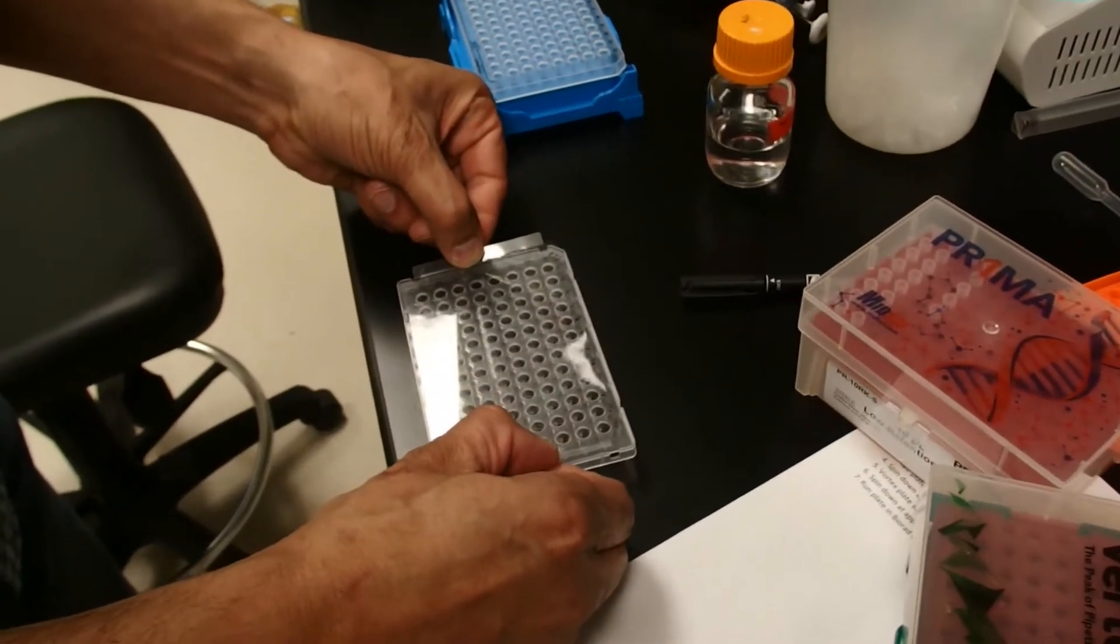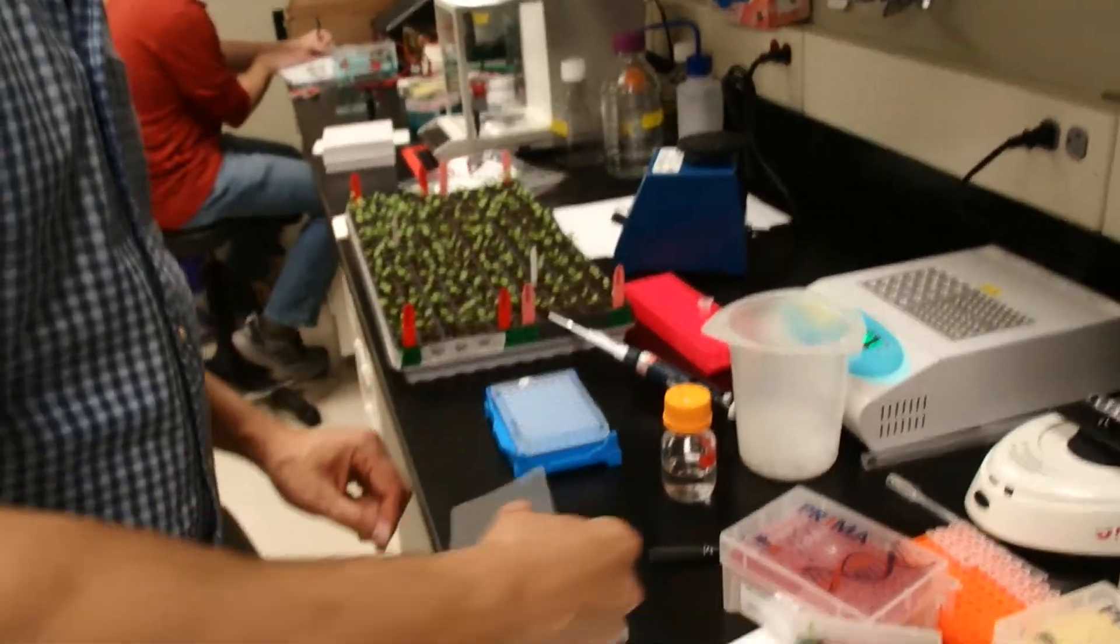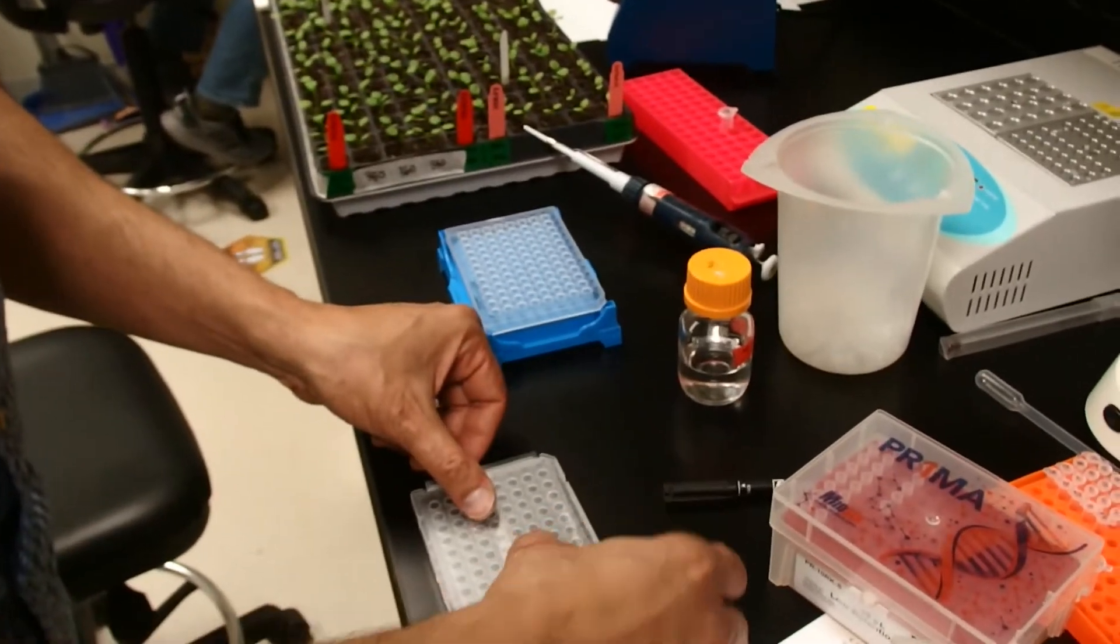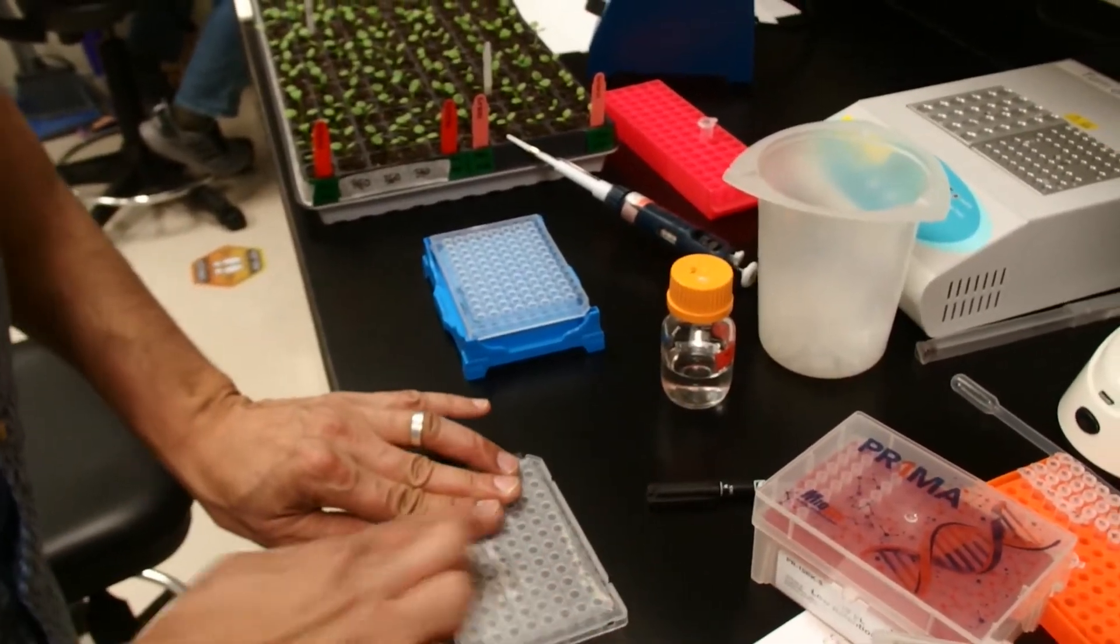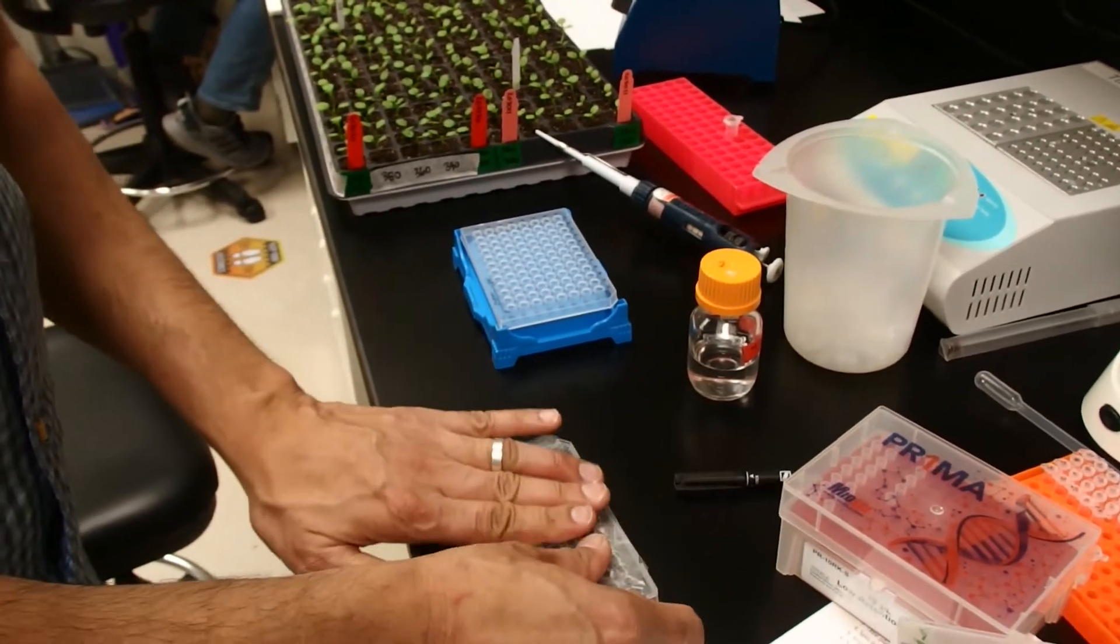I'm just going to put this on there pretty evenly so you cover all the wells. We'll use this piece here, the part that was touching the sticky part, and we'll put it on here so that we don't have to get our fingerprints and other scratches on here, and we'll use this to seal it.